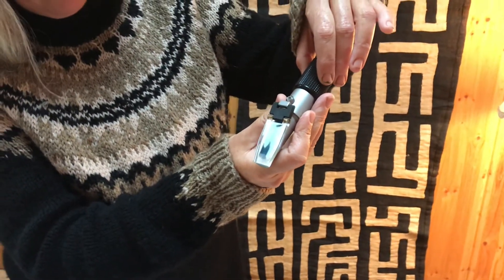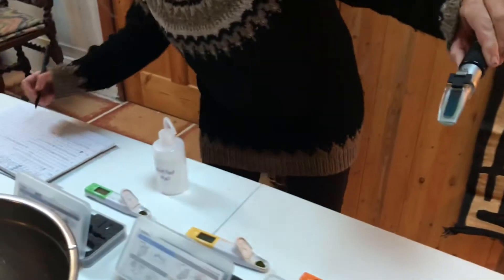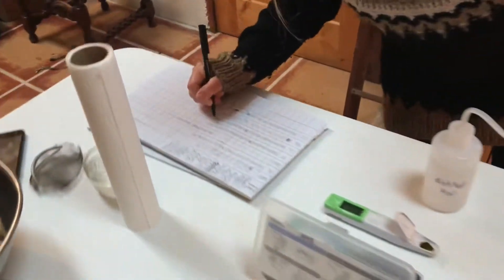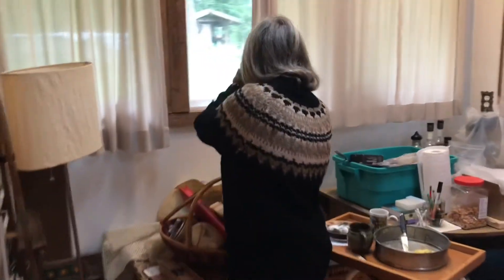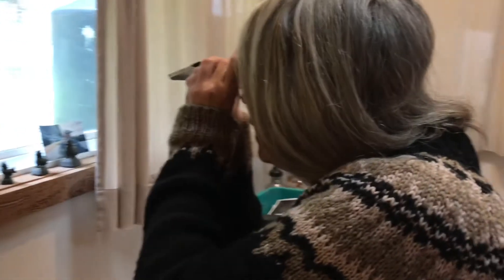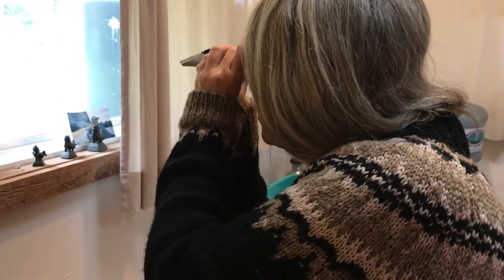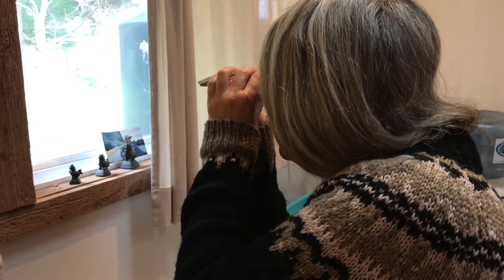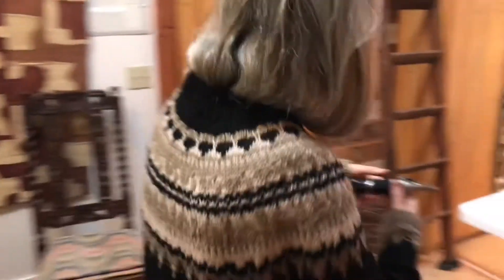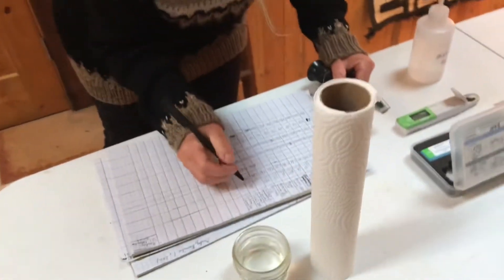It may take a little bit of time. The calcium reading is 4200. To get your reading for the Brix, which measures sugar content, bring it up to the light. It's fuzzy or straight, with parts in between — on a range of one to five, one being straight and five being fuzzy. You have to judge that line. This one's 12, really in between fuzzy and straight, so I'll put it at a three. And that's how you do it.